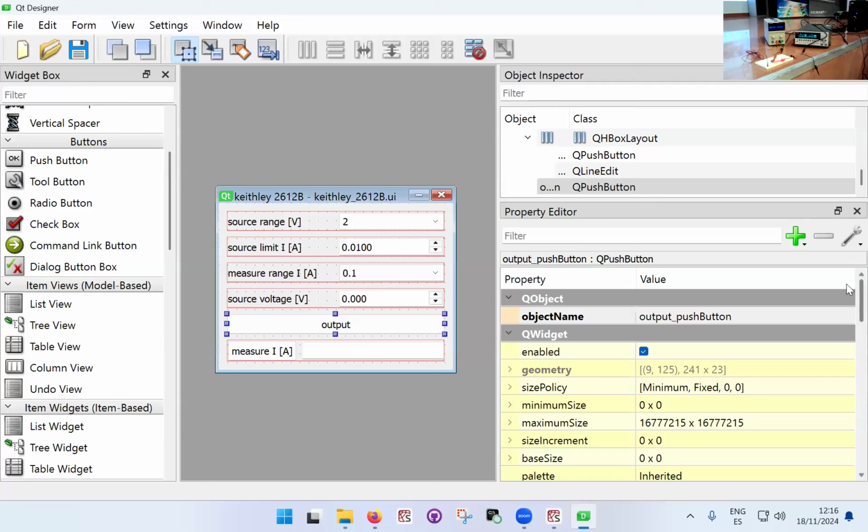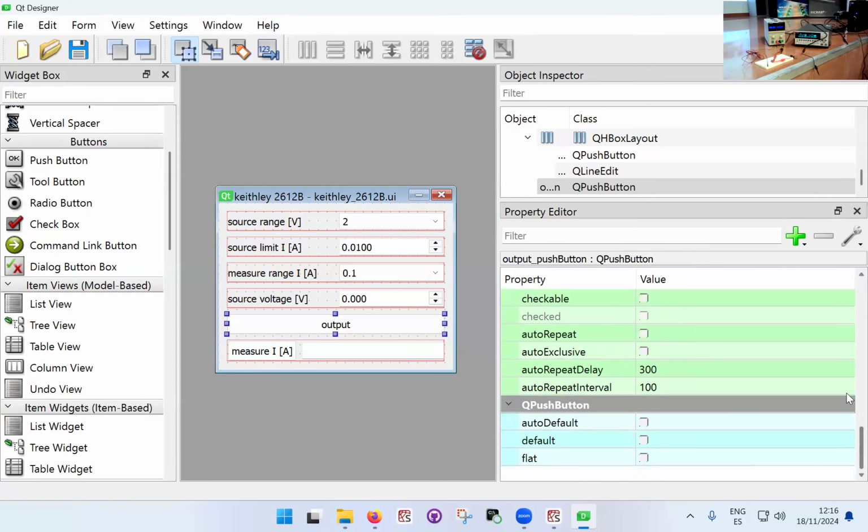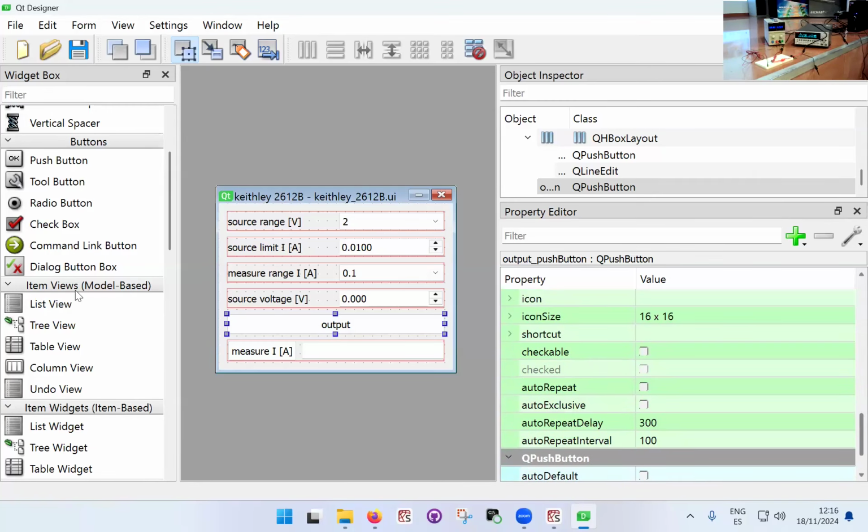But implementing this as a button, what actually makes sense to do is to have either a button to turn it on and a button to turn it off, or what you can do, and this is a specific advantage of these push buttons, is that you can set it as checkable. This means that when I click the button, it will sort of remain pressed visually, and then I can press it again so it comes back to the original state. You're going to see it will be completely obvious once I execute for the first time. So I'm going to set it as checkable.